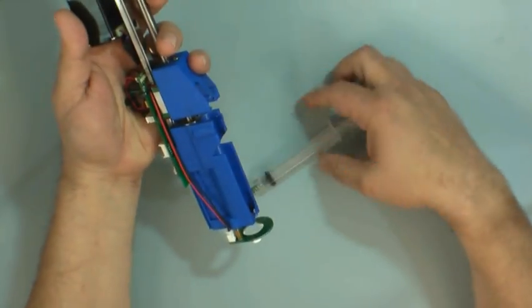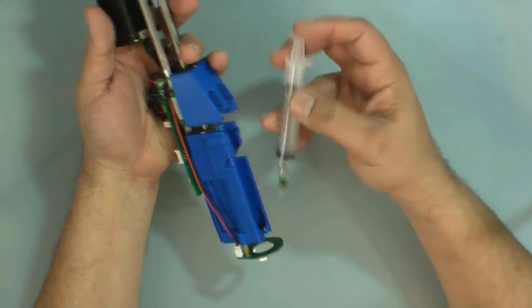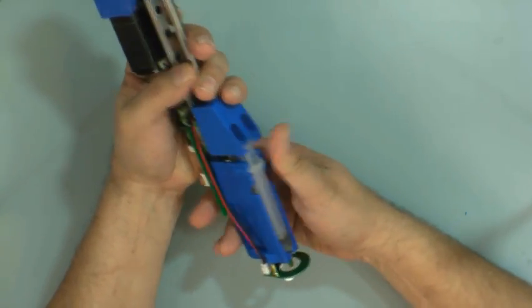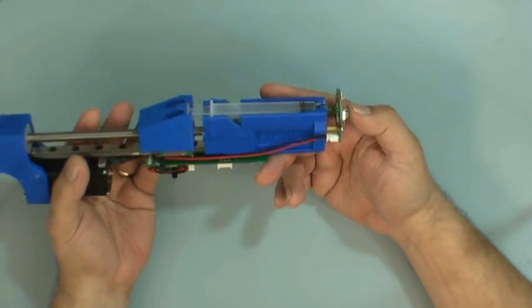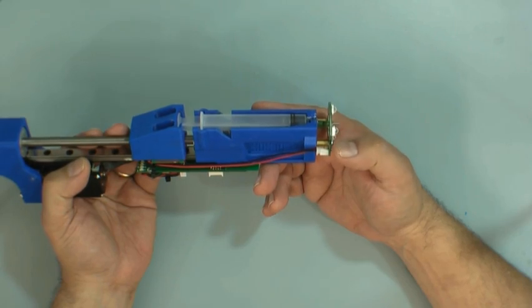The body houses the syringe. You will have to snip off one of the fins on the syringe so that it can insert like this, and it's ready to advance and retract for dispensing. You want to make sure your luer tip is long enough to go out below the LEDs if you have a cross-linking version.